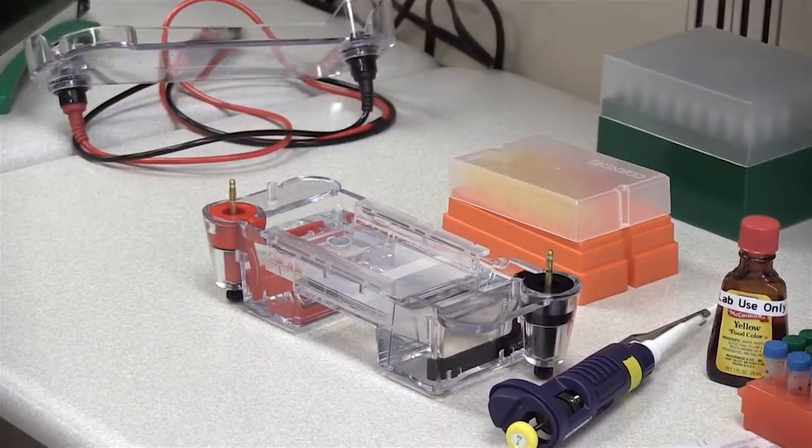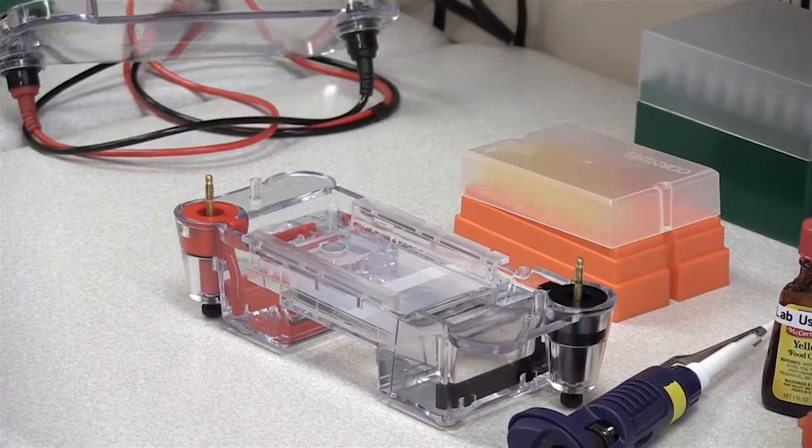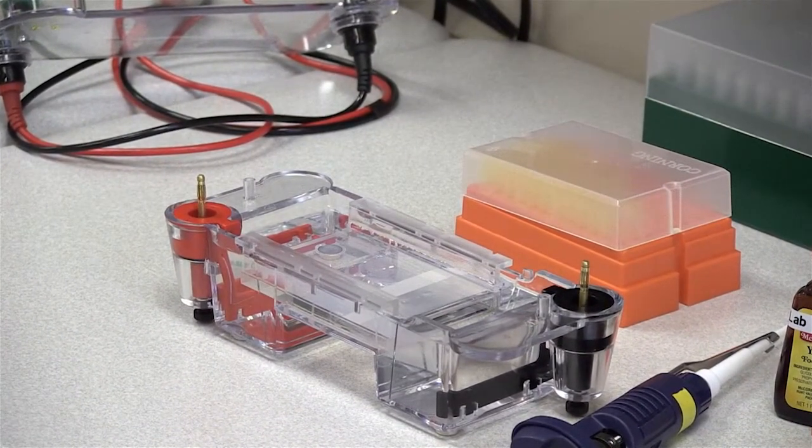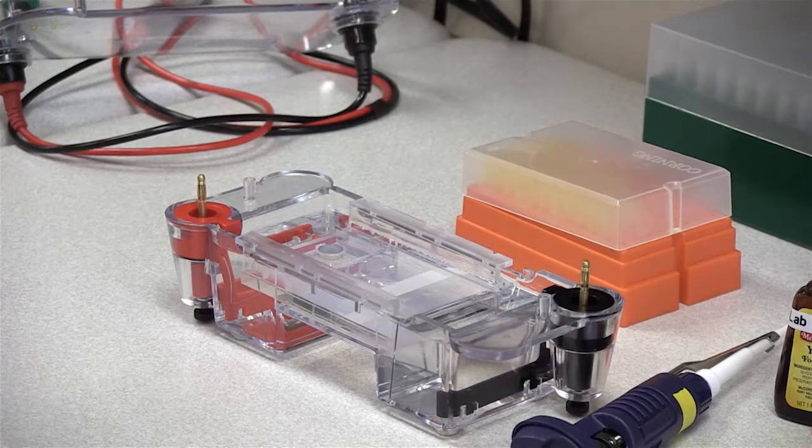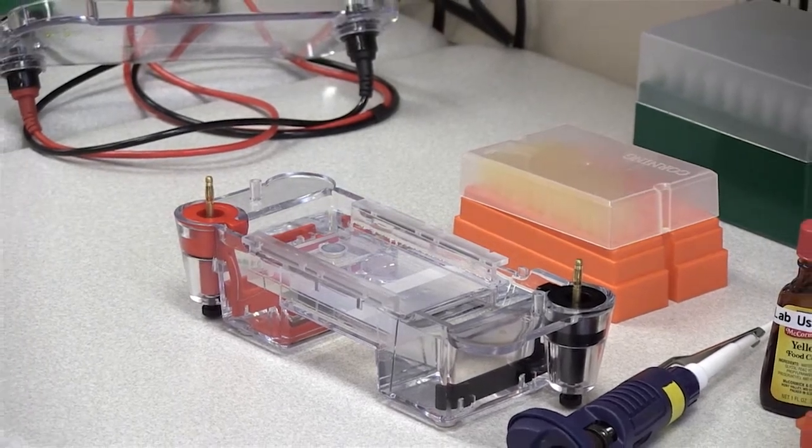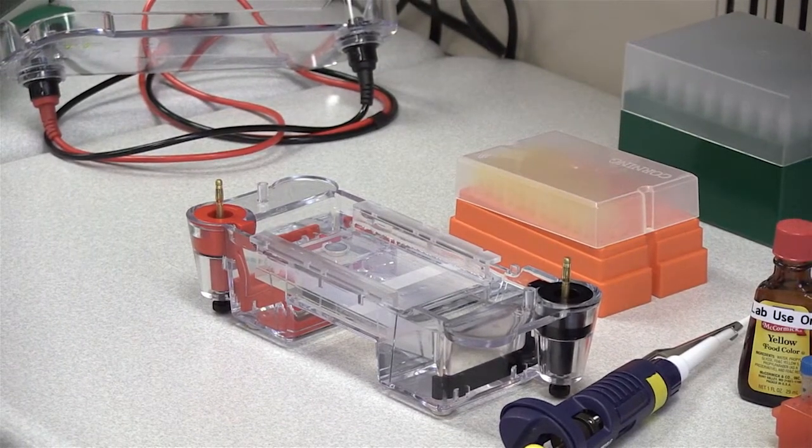Now that you have the gel submersed in the buffer, seeing the wells is going to get pretty tricky. So luckily the samples have dye. You guys are running dye samples. So we can add those and it will be able to help. You just want to be very careful when you load the samples not to be too shaky, don't have too much coffee. Make sure that you can steady your hand and not poke through the sides of the wells.